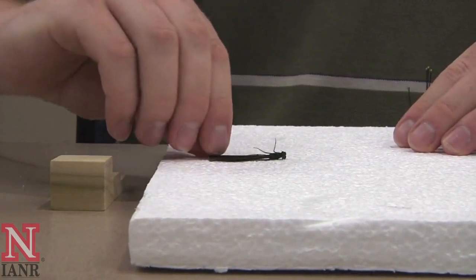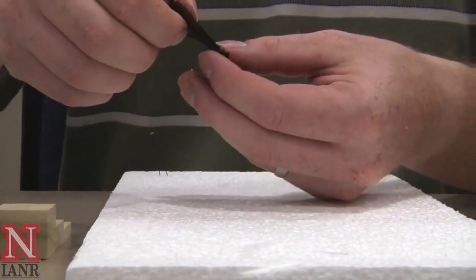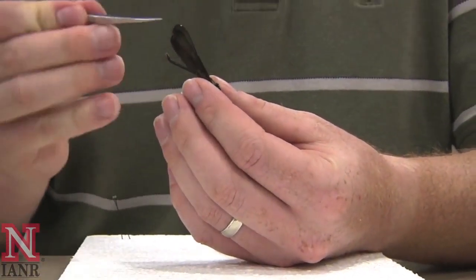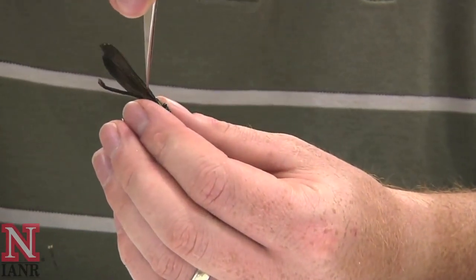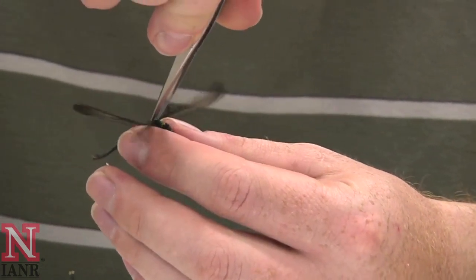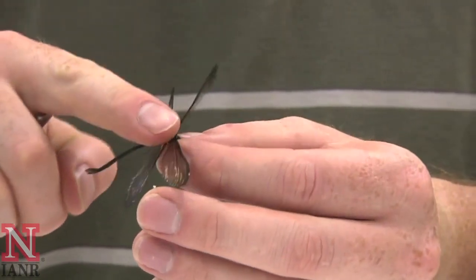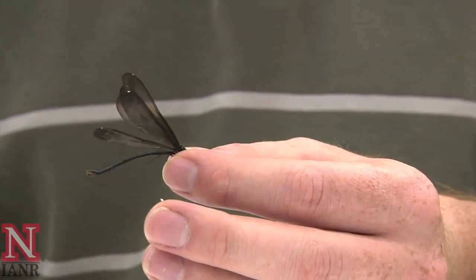Get it picked up so it's pinned. Often times the wings are stuck together, and there's a nifty little trick: pinch it between your forefinger and thumb, take forceps, squeeze the ends together, stick them in between the wings, and let them open up so you can push the wings down and get in between them. Sometimes you can also push it down with your fingers a little bit to help get that pin in there.